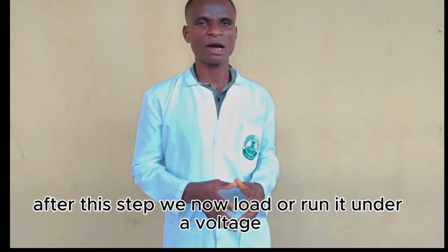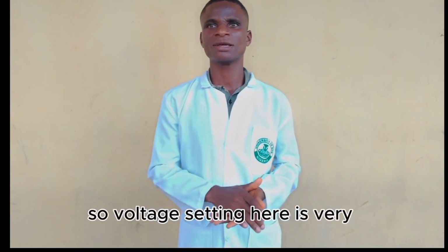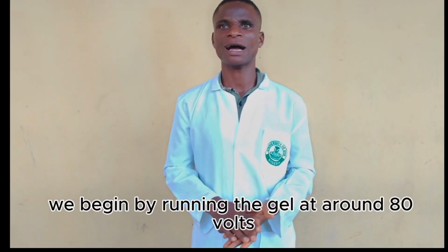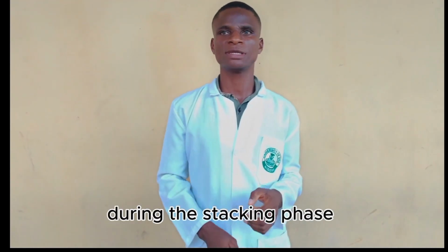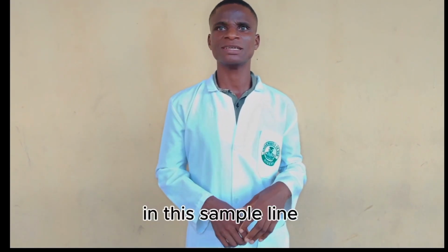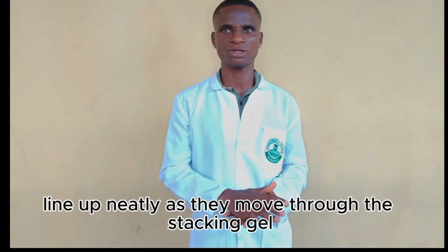After this step, we now run it under a voltage. So the voltage setting here is very, very important for separating the proteins effectively. We begin by running the gel at around 80 volts during the stacking phase. This low voltage ensures that all proteins in each sample line up neatly as they move through the stacking gel.